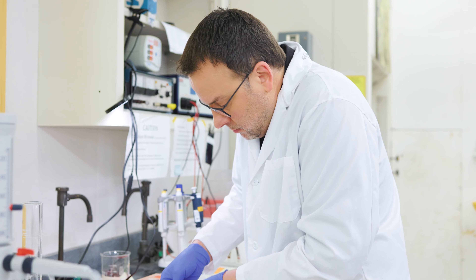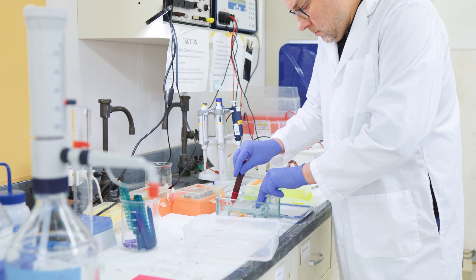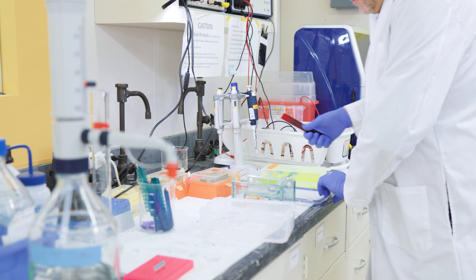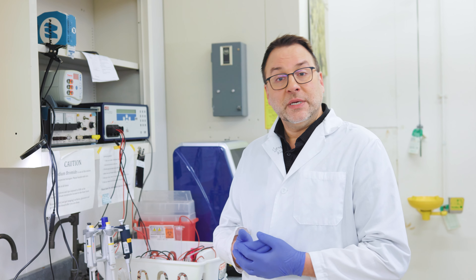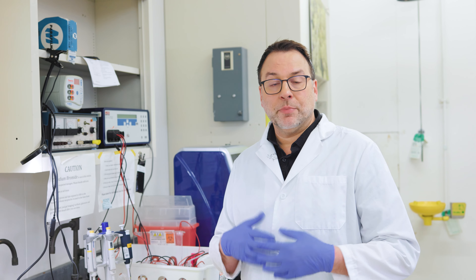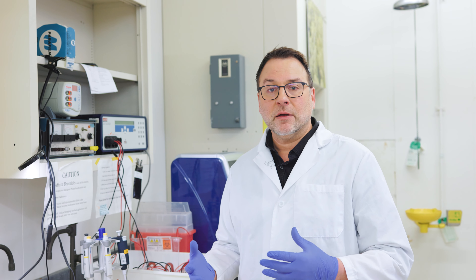Scientists use what's called a DNA barcode, which is a standard region of the genome — one, two, or three genes that they use to identify parts of organisms that they could not otherwise identify. So what I'm trying to do here is amplify a couple of genes from that seed, and use that to query a database to figure out what kind of plant that actually was.